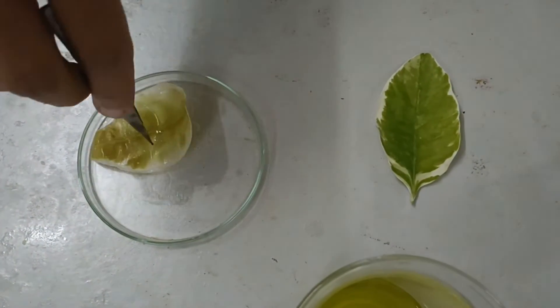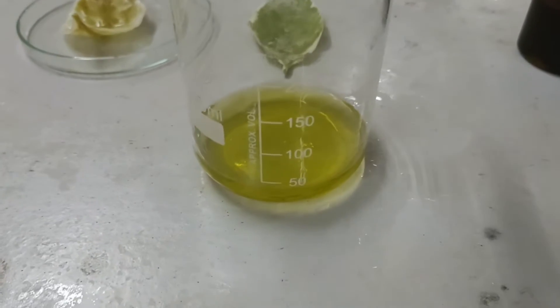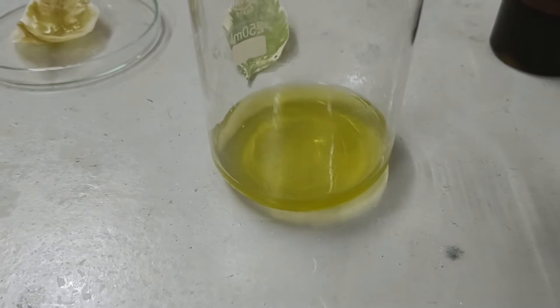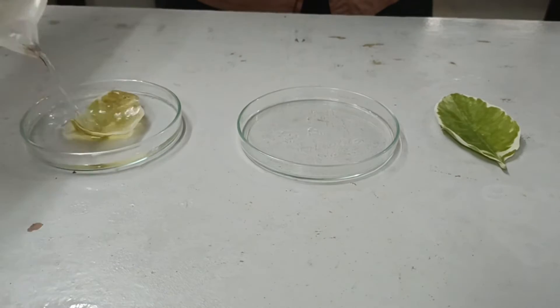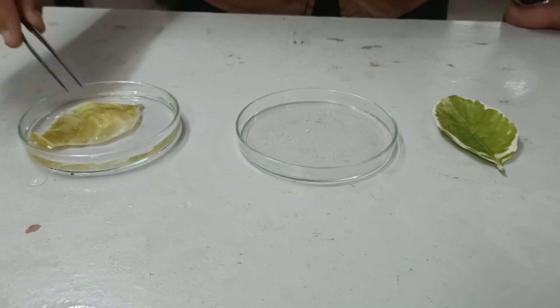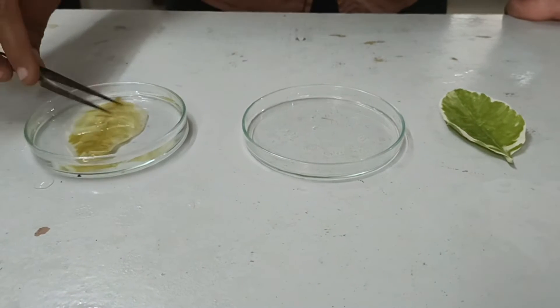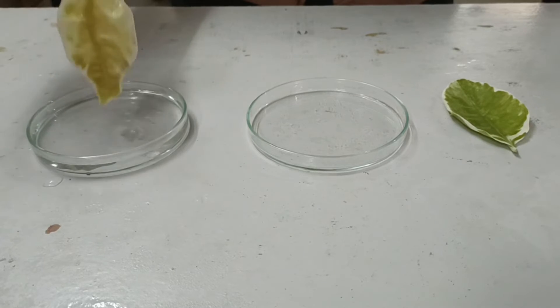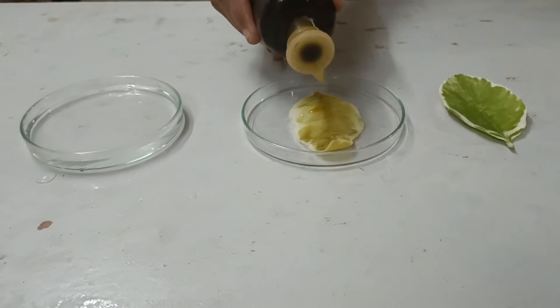Now let's pull out the leaf from the alcohol and put it into the Petri dish. Please note the color of the leaf before and after, and also notice the color of the alcohol which turns green. Let's clean the alcohol gathered on the surface of the leaf with clean water, then transfer the clean leaf into another Petri dish. Now gently pour a few drops of iodine solution over the surface of the leaf.